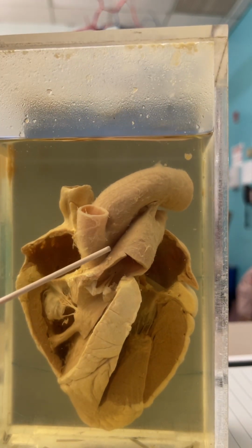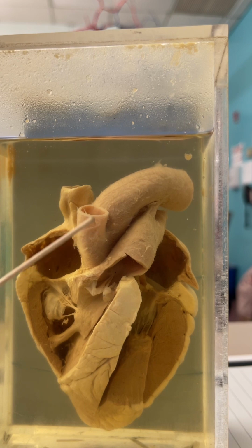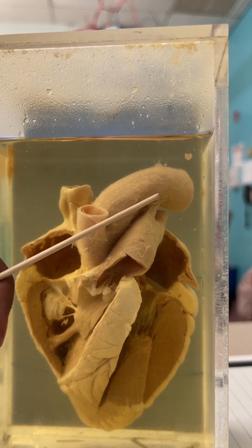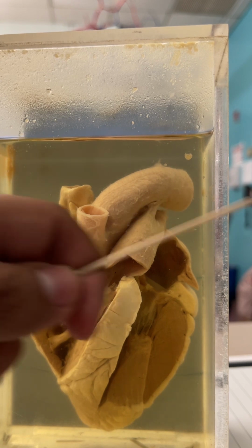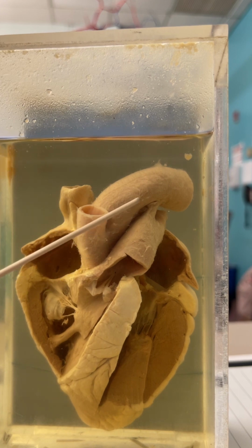And the aorta has it split. On the sheep heart, instead of 3 vessels coming off the aortic arch, it's only 2. This is the brachiocephalic trunk, and this is the left subclavian. Technically, this is the aortic arch, and it'll go into the left subclavian, but the brachiocephalic trunk will split into the right subclavian, and then both common carotids. Does that make sense? So brachiocephalic trunk, aortic arch, and that will eventually go into left subclavian.